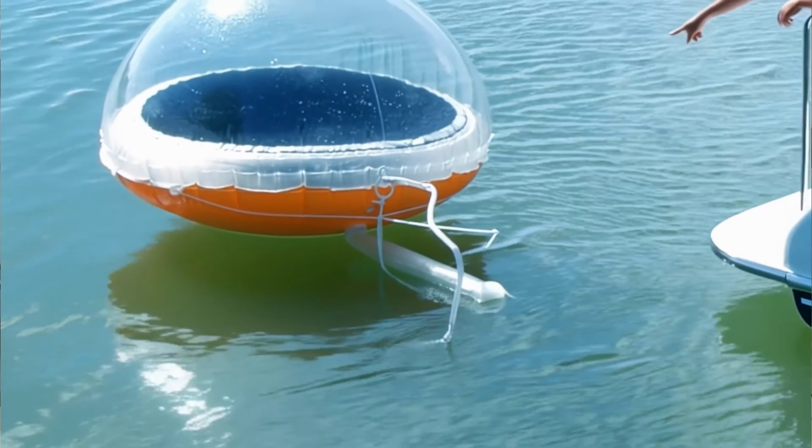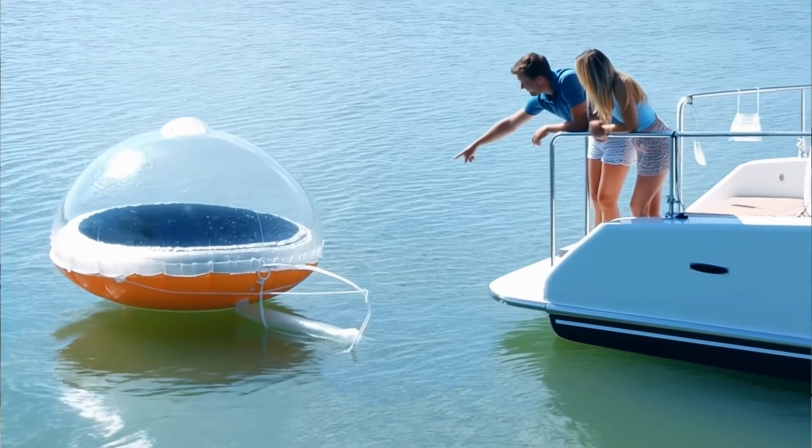So having checked the boiling point of the water, I've found that it is 100 degrees Celsius, and that is one of the tests that you're required to know at GCSE to confirm that you have pure water. The important point here is that a little still, like we set up here, could be quickly assembled out of basic equipment to provide clean, safe water in the case of an emergency. And you can even buy versions that use the heat of the sun to get clean, drinkable water from seawater if you're lost at sea.